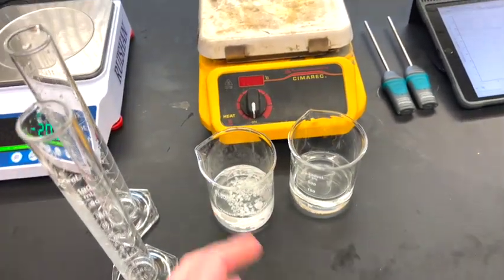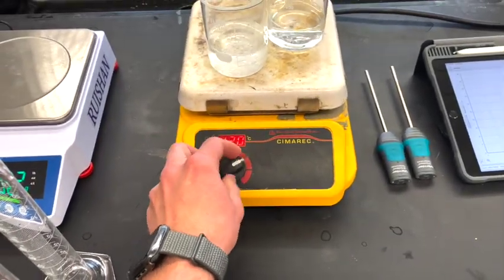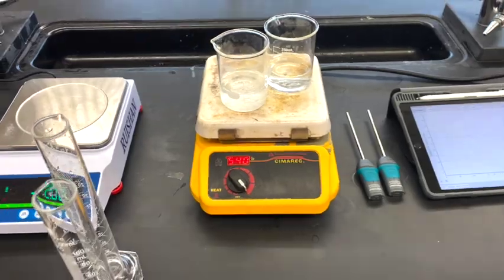I'm going to take each one of these beakers and put them on the hot plate. I'm also going to put a temperature probe inside each one so that I can monitor the temperature.